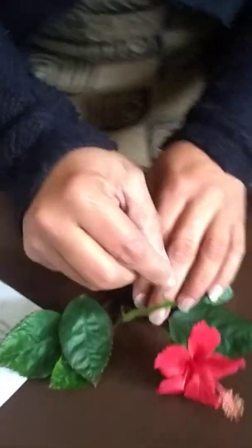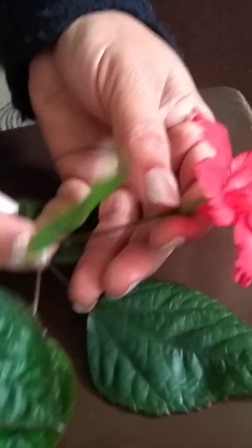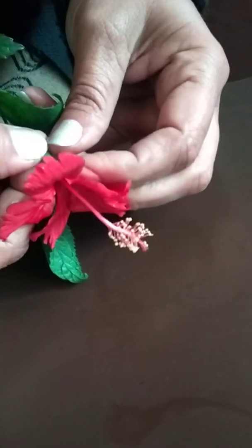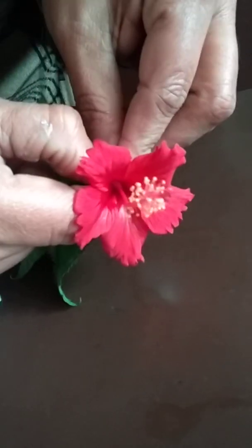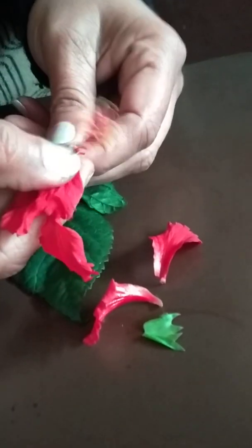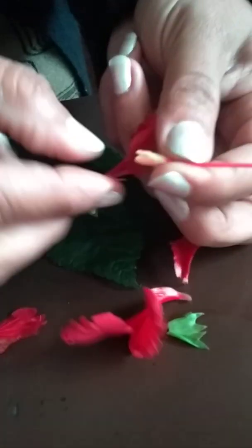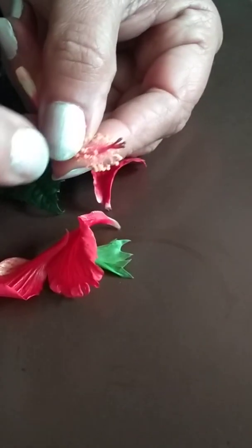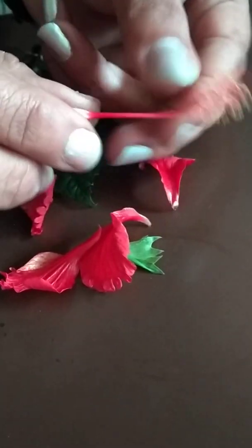I will show you what are the different parts of a flower. You can see here — this is the pedicel, and this thickened part is called the thalamus. On the thalamus, these are the sepals. If I separate them and remove the first whorl, these are the sepals. And if I remove gently all the petals — the second whorl — petals are removed. Now you will have this: this is the ovary and above it these are the anthers and stamens you can see. And at the top is the stigma. So this is the male reproductive unit and female reproductive unit of the flower.